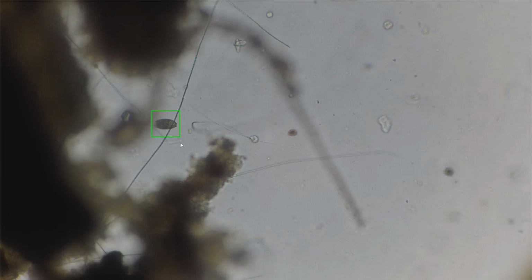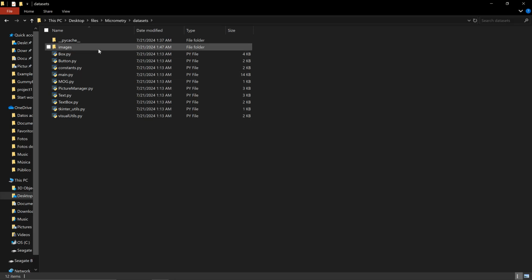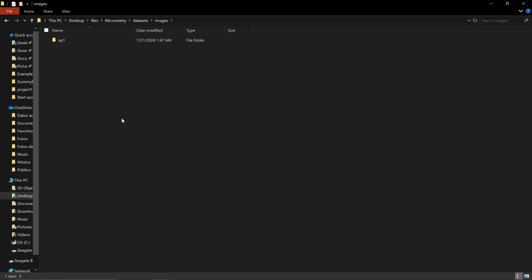Once I'm done, I can press with the left button of my mouse once more, and then you will notice that the text prefix shows down here at the bottom. I can add the label, and this is going to be my species 1. I'm going to press enter, and then the sample has been added. Where does the data go? So if we go back to the datasets folder, you will see now that a new folder has been created. This folder contains now a subfolder with the name of the label that I just added. And in here you should find the image of the sample that you just took.